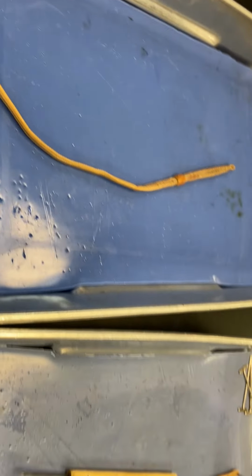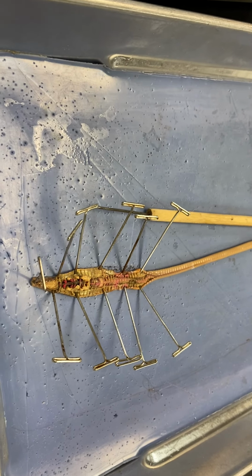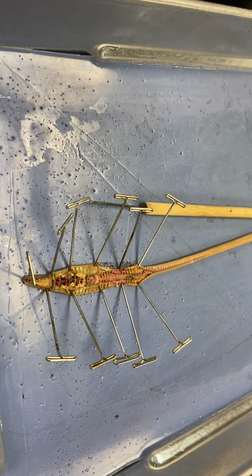So that is all for the earthworm. If you have any questions on it, please let me know, and make sure you use this as a study guide to help you know all these structures for the lab practical.